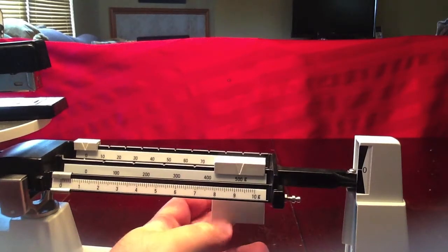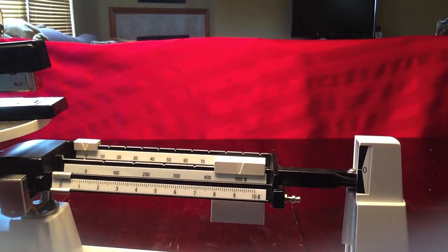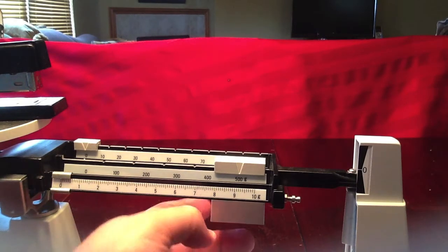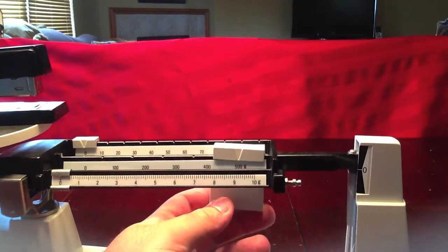Once we reach the 500 gram mark, we notice that the scale falls below zero. So we need to move the rider one notch back.